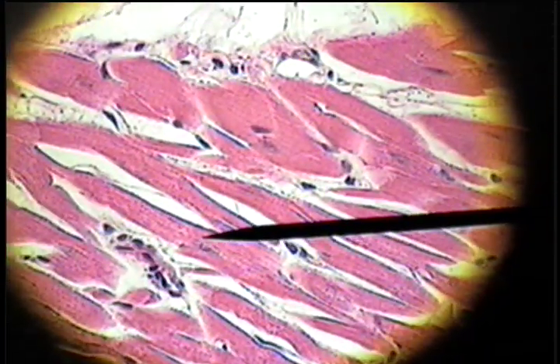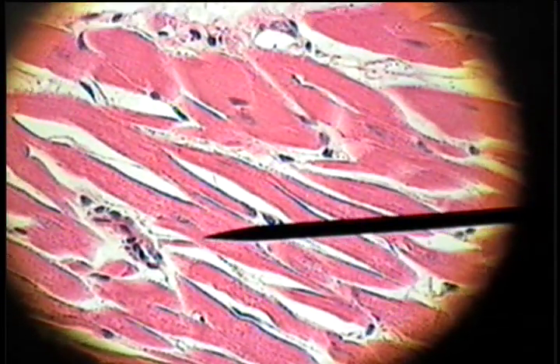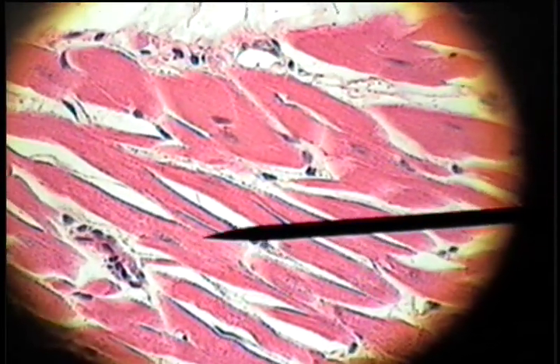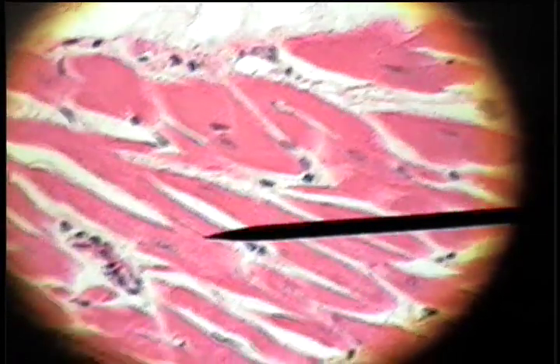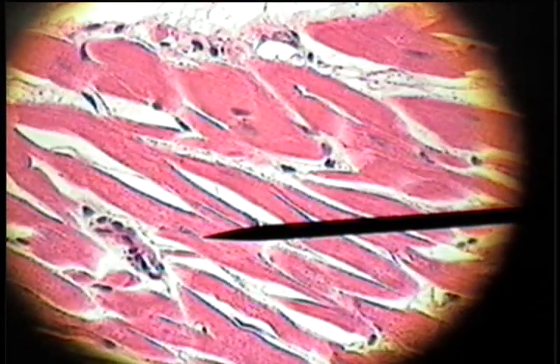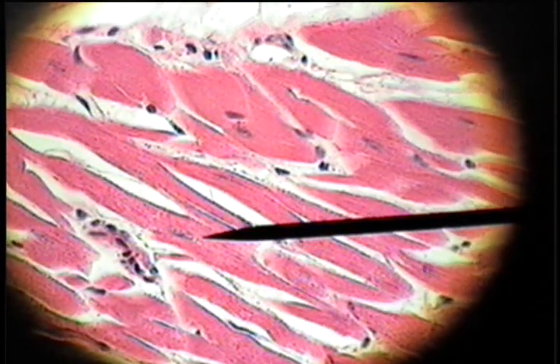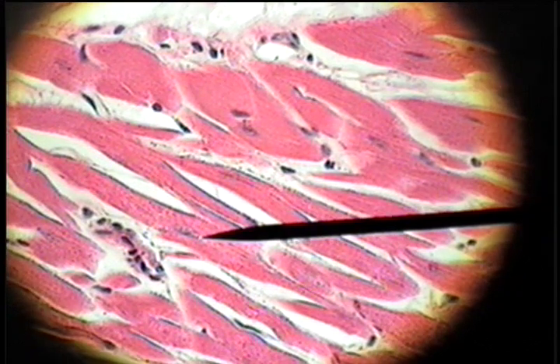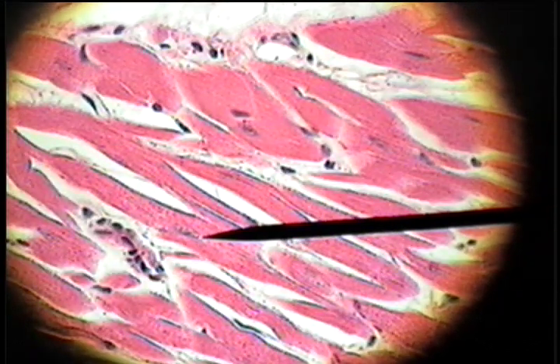Cardiac muscle is characteristic of these branching fibers, and it is cross-striated, but the nuclei are located in the center of the cell — cardiac muscle.